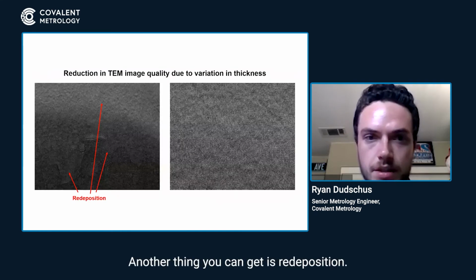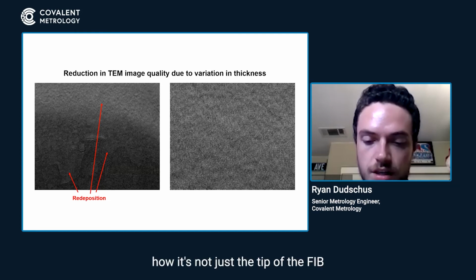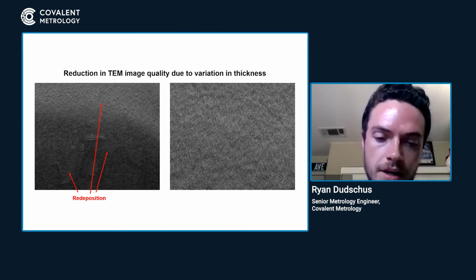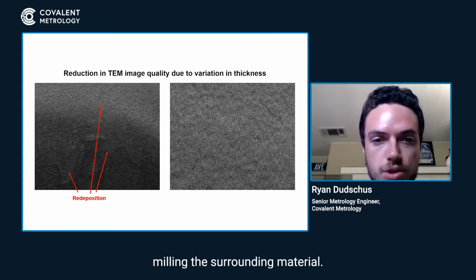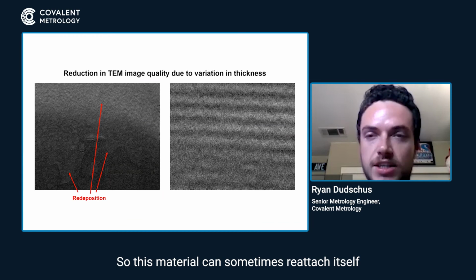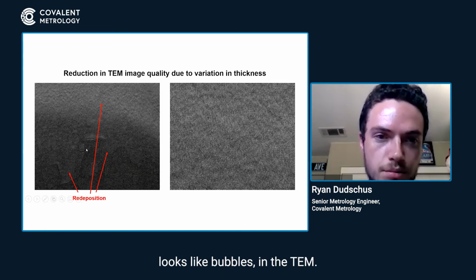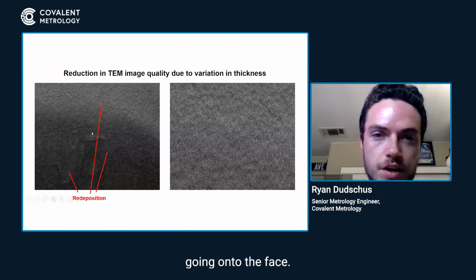Another thing you can get is redeposition. When we talked about how it's not just the tip of the FIB that's milling the material, but also the tail ends or the sides of the beam, you're not actually thinning the window itself, but you're milling the surrounding material. And this material can sometimes reattach itself to the face of the lamella. That's what you see here in this left image. You see all these bubble-looking features in the TEM, but this is actually redeposited material going onto the face.